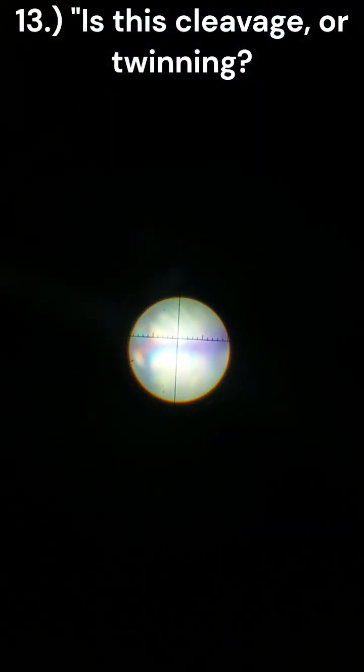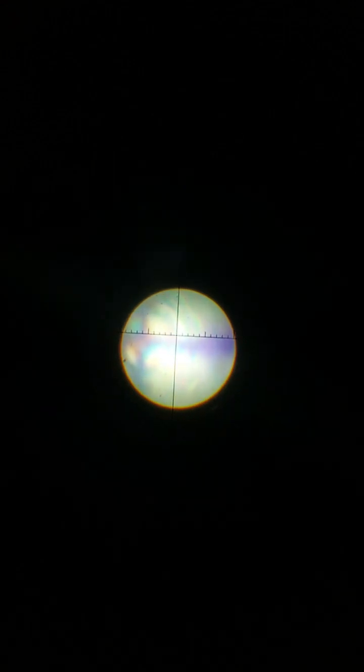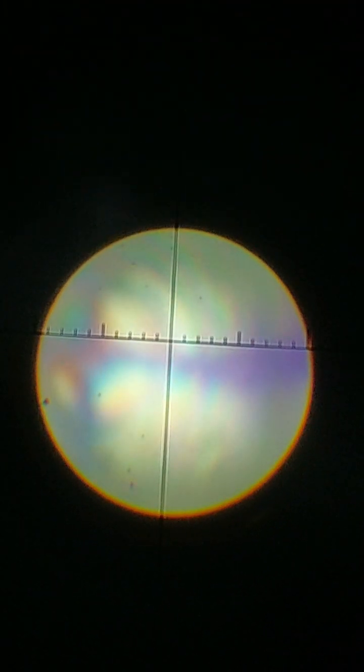I'm going to focus. When I rotate this around, it looks like those are not isogyres that will separate. It actually looks kind of to me, well, I mean, right there it kind of looks like they're separating, but they seem to keep their positioning. And so I think this is uniaxial. I'm putting it back there where it's kind of the best view. I think that that would be negative.